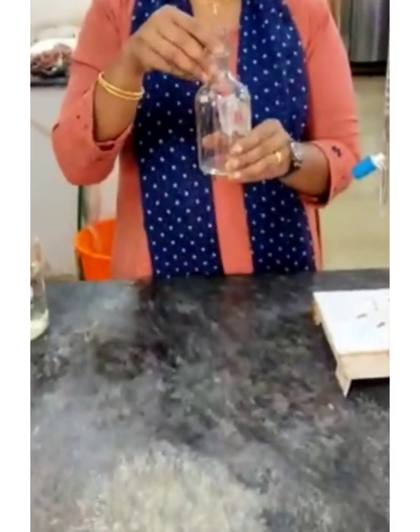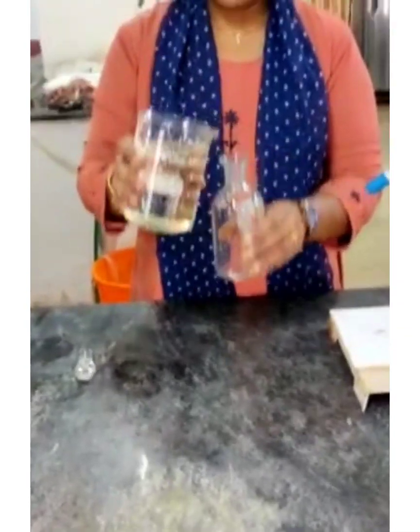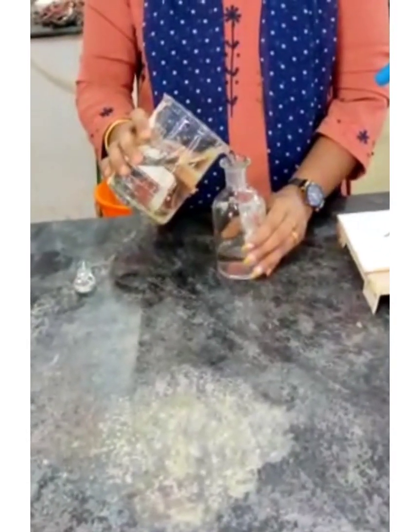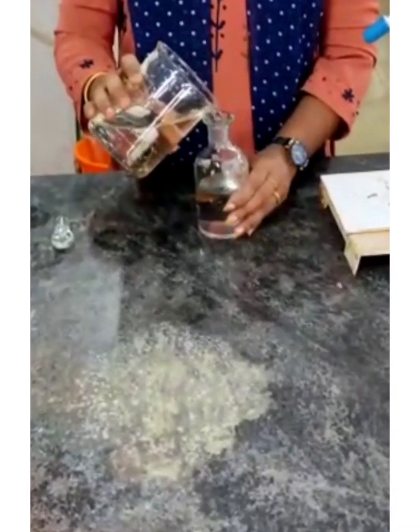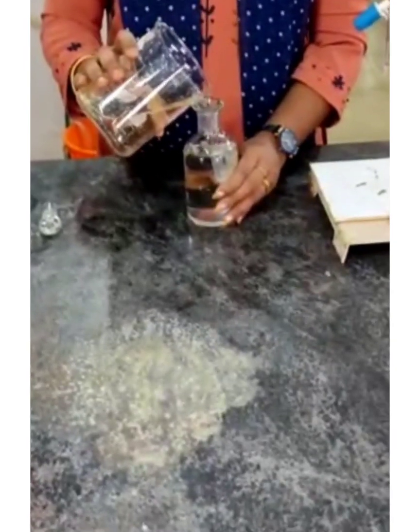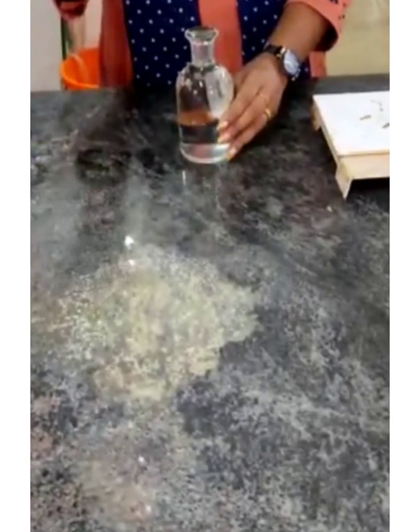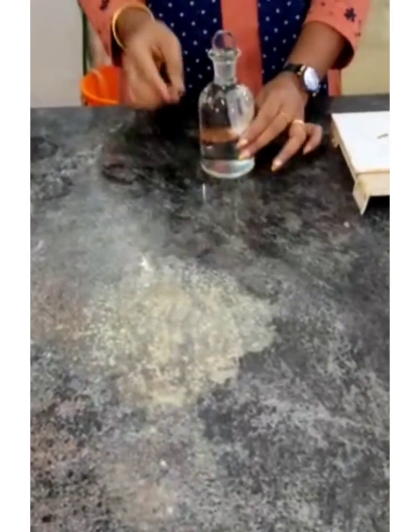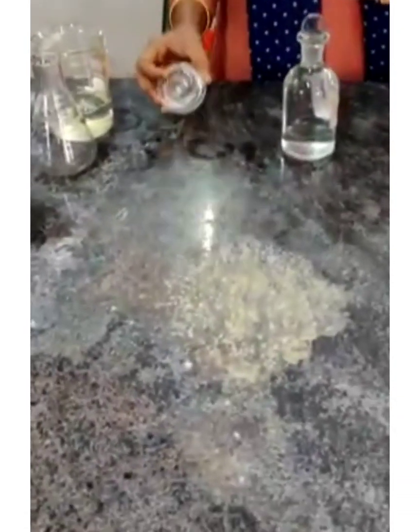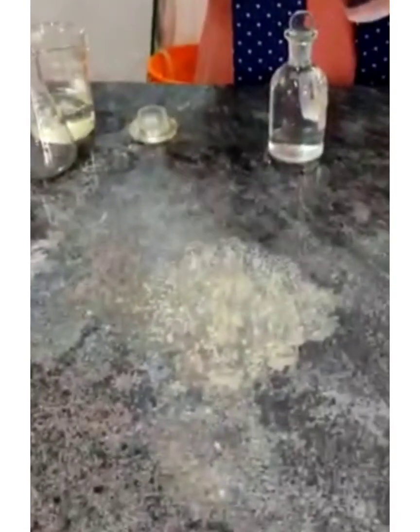Let us start the experiment. First, we take the sample in a 300 ml BOD bottle. Add 2 ml manganese sulfate solution to this BOD bottle.